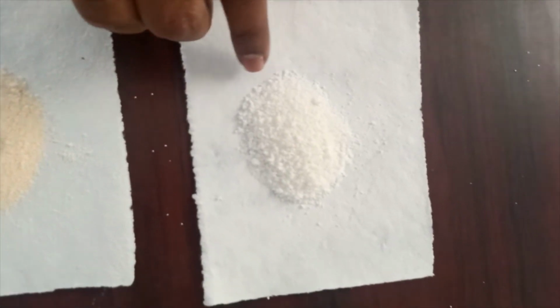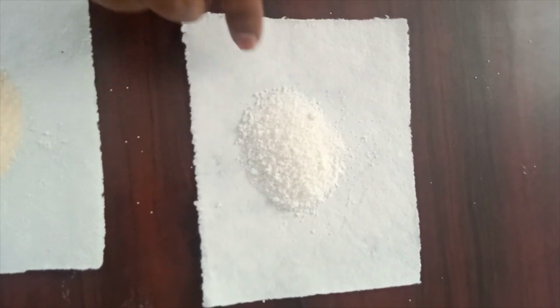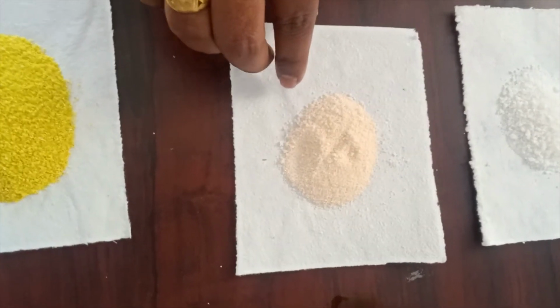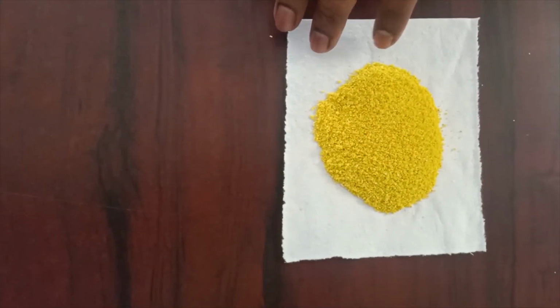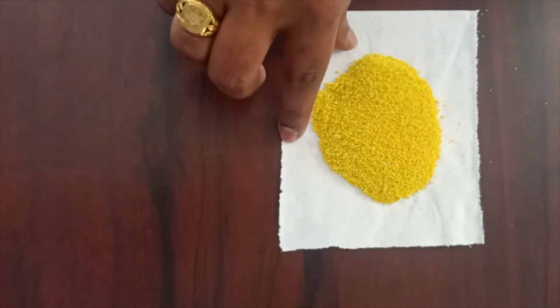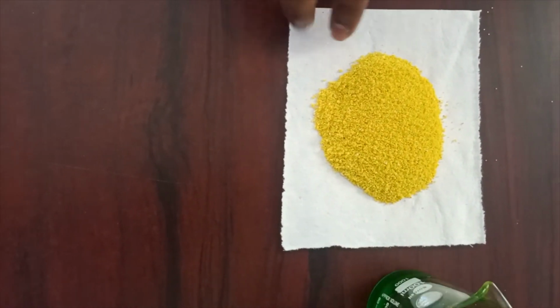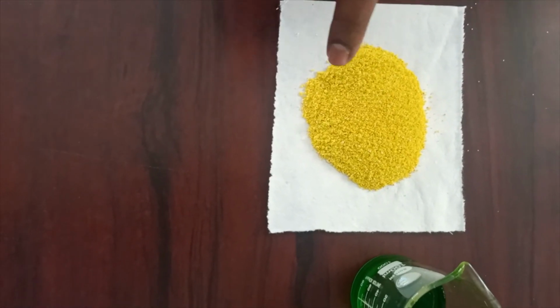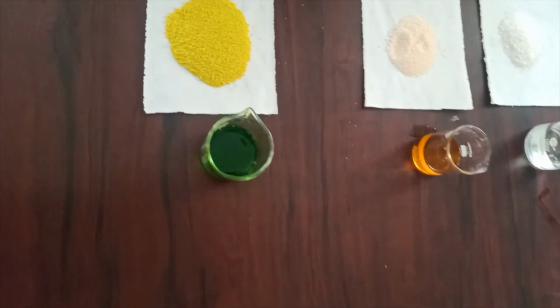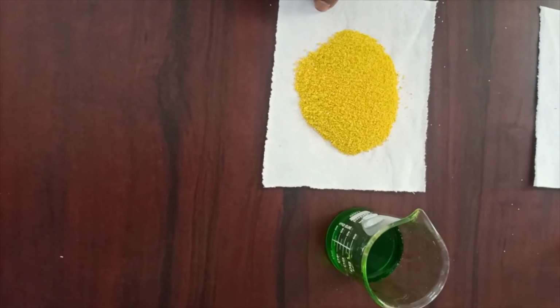These are seal coated granules, HPMC E5 on sugar spheres. These are drug loaded spheres, and these are the final formulation, drug loaded with a release retardant polymeric material, that is HPMC K4M. These spheres contain sugar spheres of 425 microns, drug solution, and the final coat is the polymer coat, that is HPMC K4M.